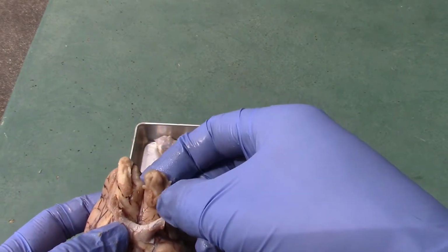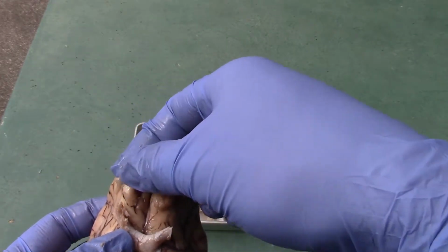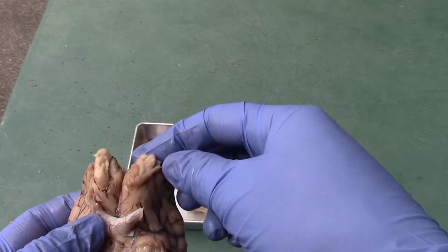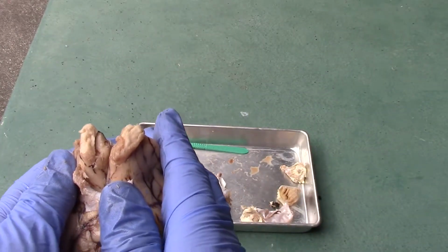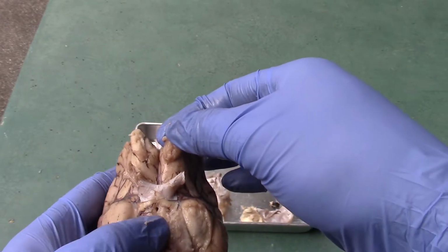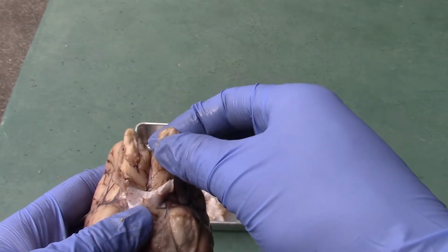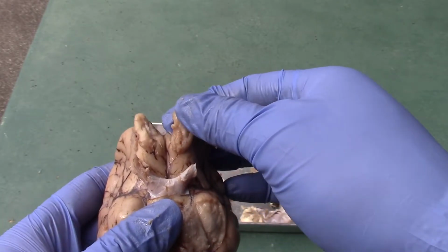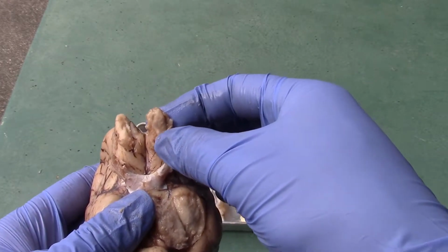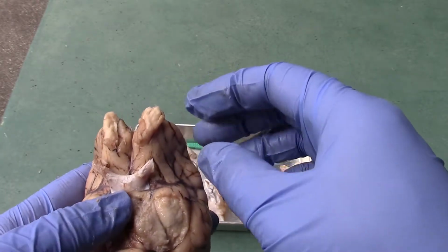Okay, we have the olfactory bulbs here. You could see and compare this to our human brain's olfactory bulb. Compared to how small this brain is, the ratio between the two shows you that the sheep should have a better sense of smell, because their olfactory bulb is a lot bigger in order for them to have a better sense of smell. Compared to the size of our brain, our olfactory bulbs are rather small in comparison.